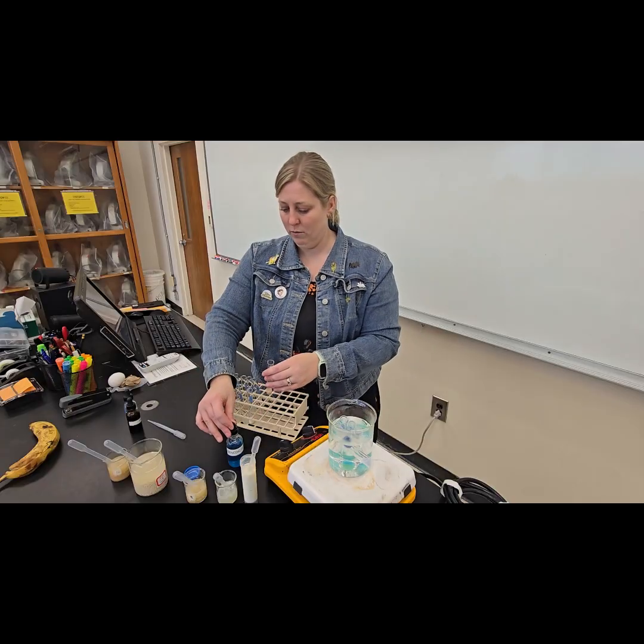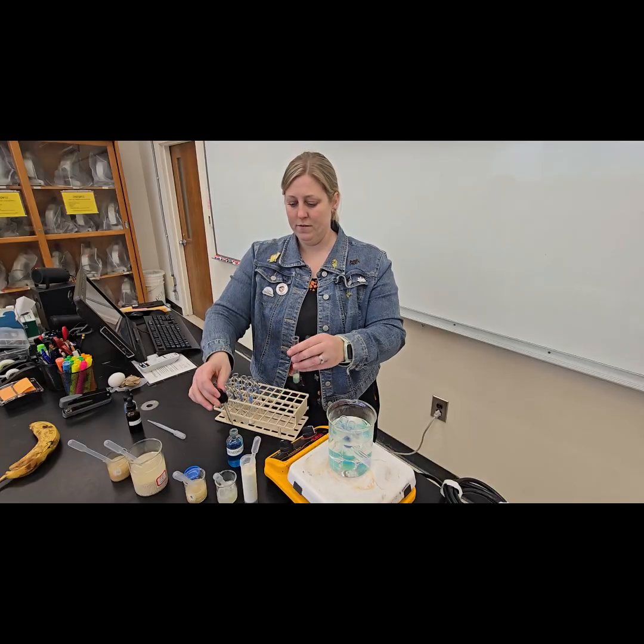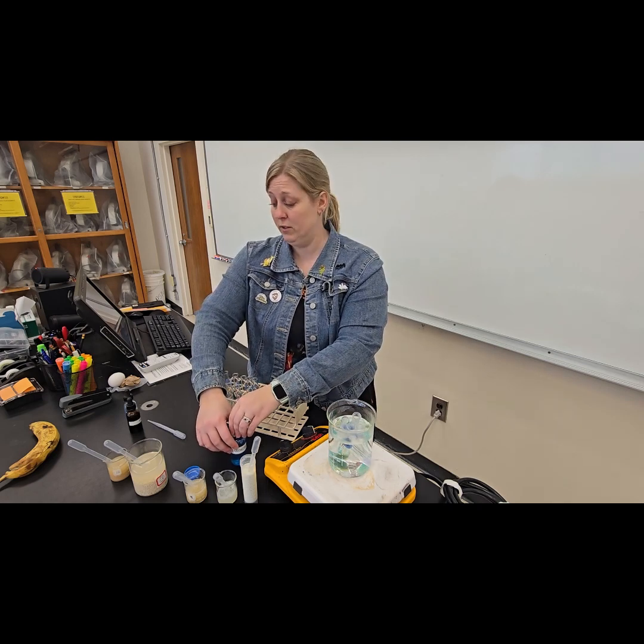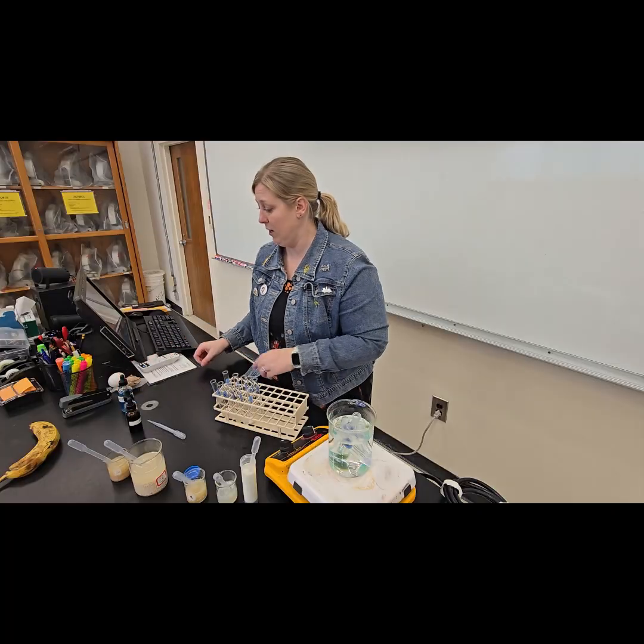4, and then our unknown. 5, and we're gonna let those sit while we run the other tests, which will have immediate results like you saw in the positive and negative controls.